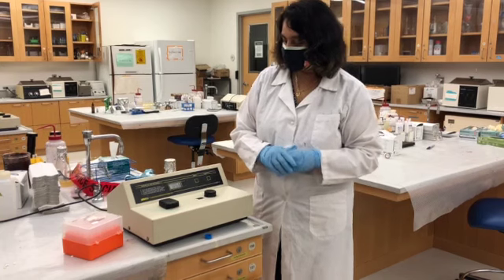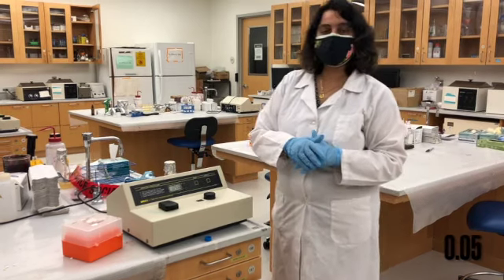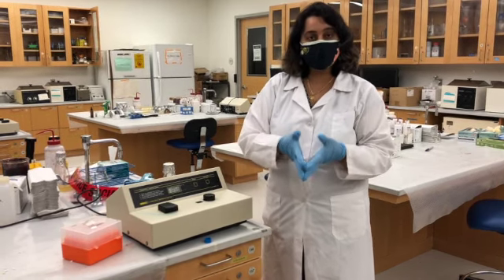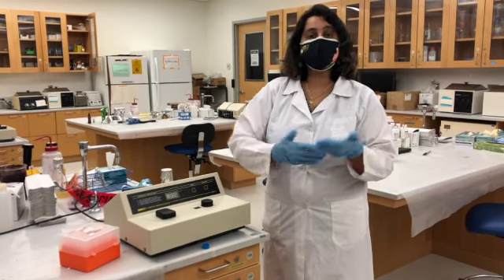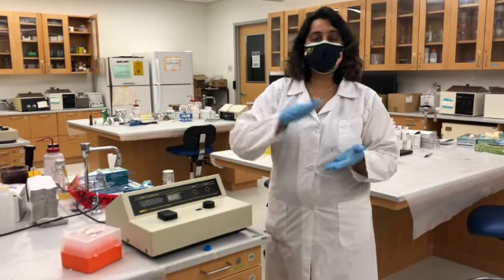So all you do is just wait to see the absorbance. As you can see, the reading is pretty low because the bacteria is still in the lag phase. The bacteria would take a long time to stabilize, they would adjust to the new surroundings, and then depending on how fast they are picking up, maybe after 2 hours, the absorbance would double up. Okay, so this is still at 0.05 because the bacteria is still in the lag phase.